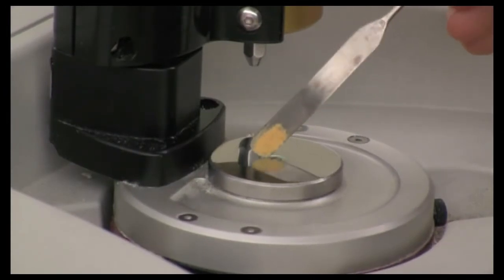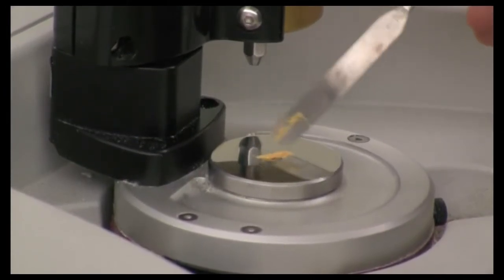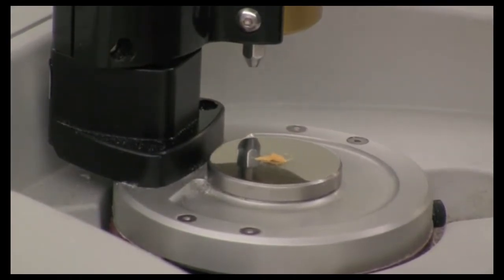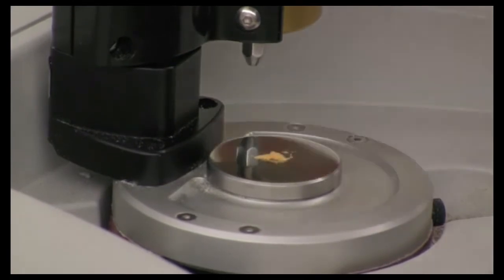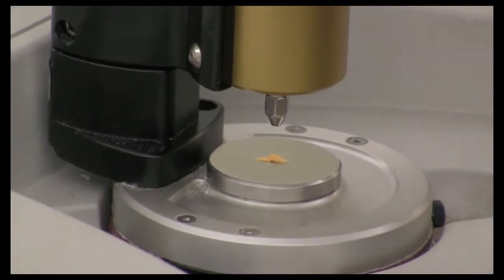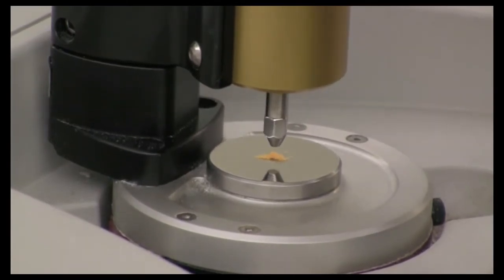If your sample is a solid, place just enough of your solid material to cover the opening over the diamond. Remember, with solids, you want to make sure that your solid is crushed as finely as possible so that you get maximum surface area contact with the face of the diamond. Then again, turning clockwise, lower the anvil over the surface and start pushing the solid material up against the face of the diamond. Don't worry about over-tightening, because you will not be able to over-tighten the anvil. You'll hear it click, so listen for the click, and that will tell you you're putting as much force as you can against the diamond.